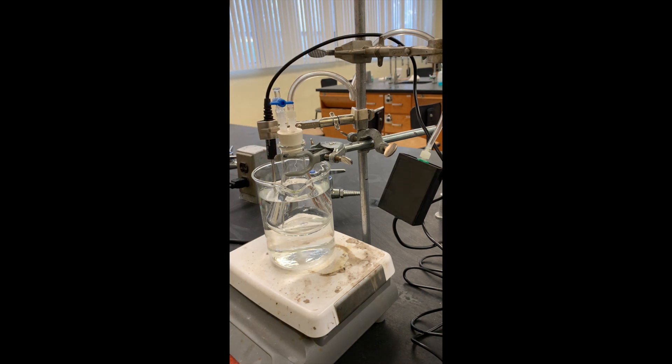I'm waiting for a constant pressure on the LabQuest. When we get a constant pressure, I'll ramp up the temperature. It looks like we've got a pressure of 109.22 kilopascals — atmospheric pressure is right at 100 kilopascals. The numbers are bouncing around a little bit, around 109.09, and temperature is 24.5 degrees.